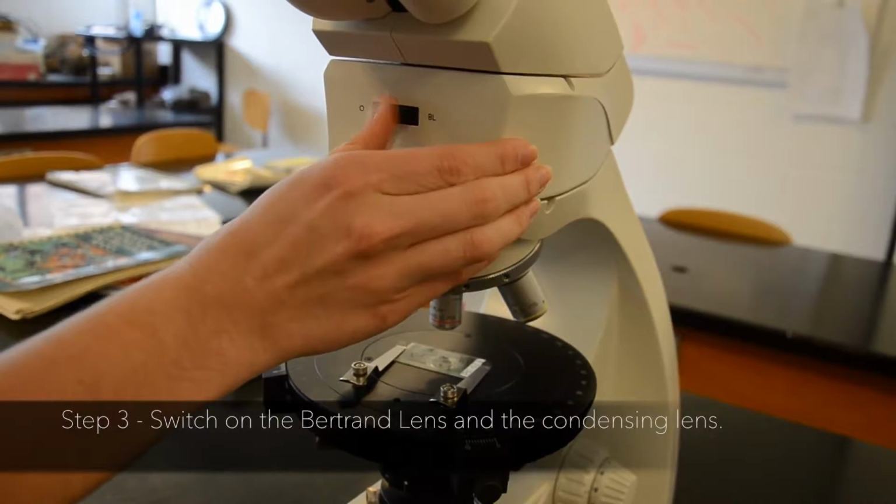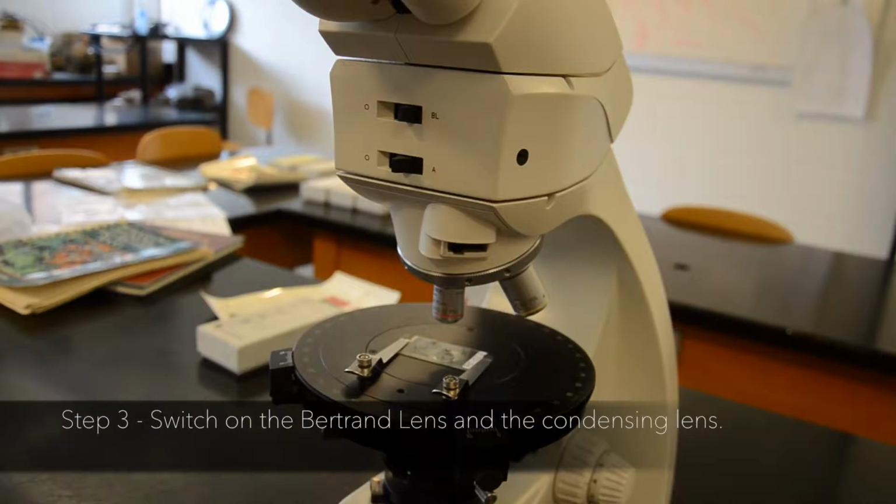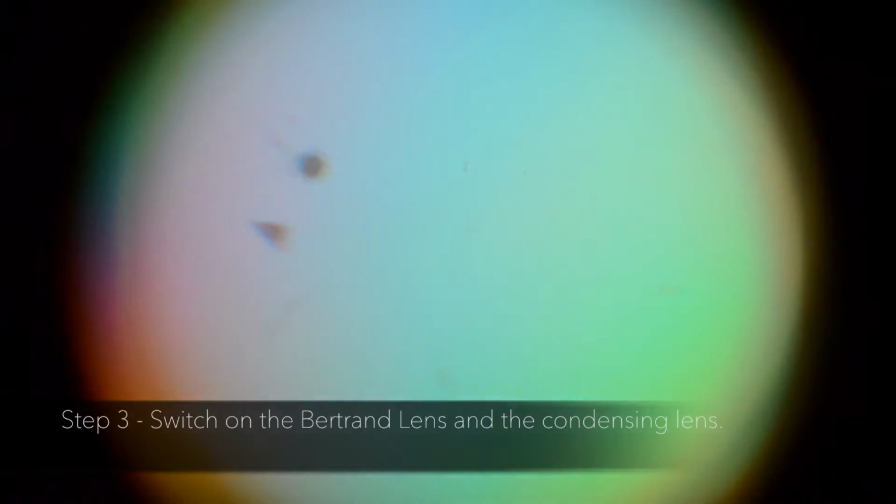Step 3. Switch on the Bertrand lens and the condensing lens. On this microscope, the switch labeled BL above the cross-polarizer switch inserts both.